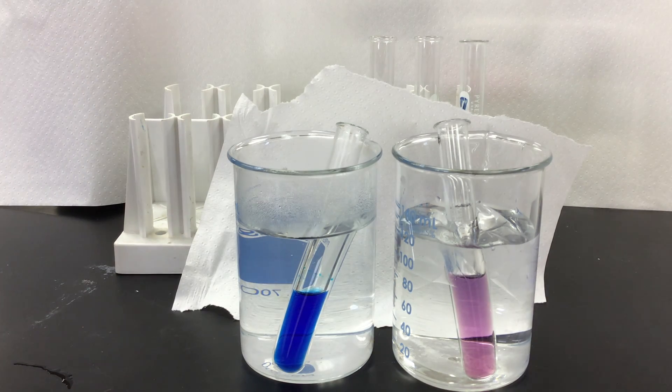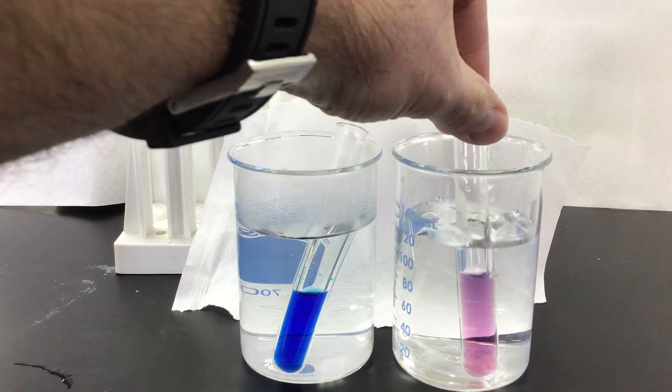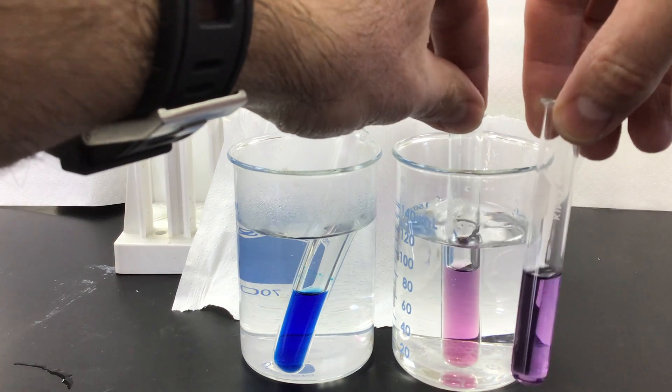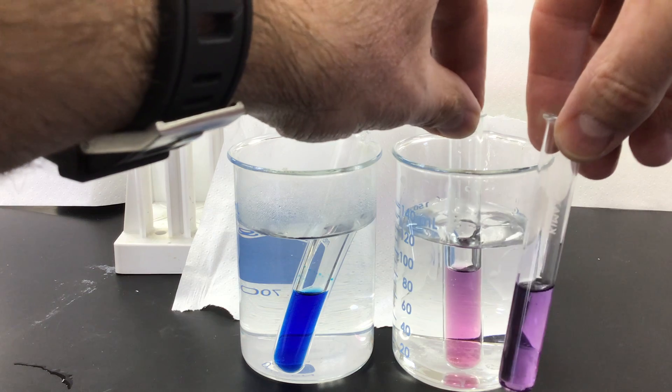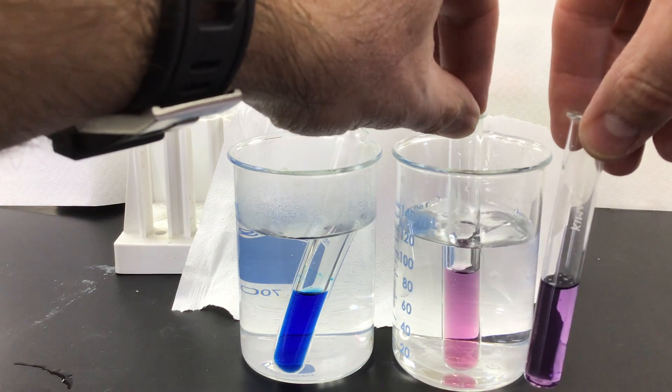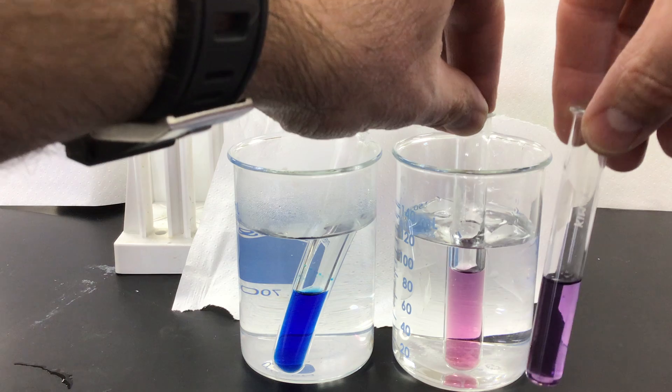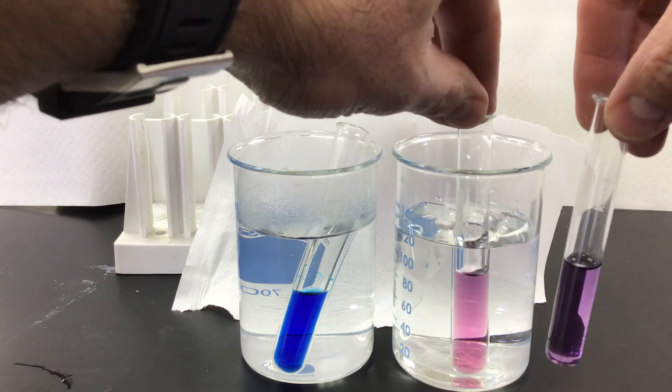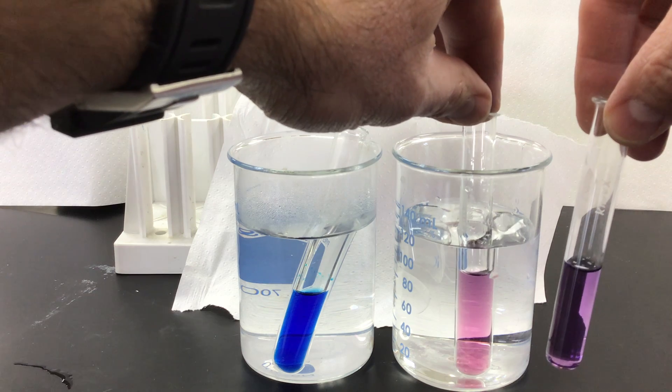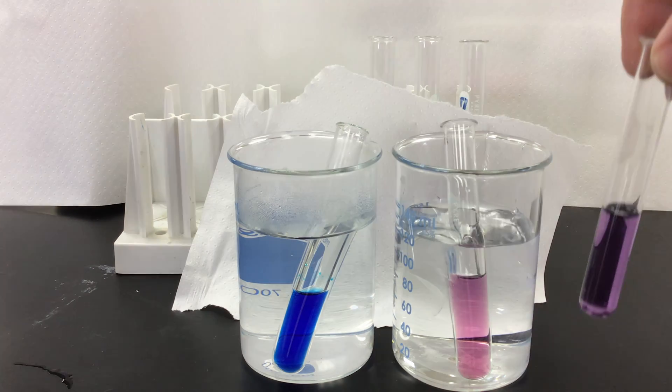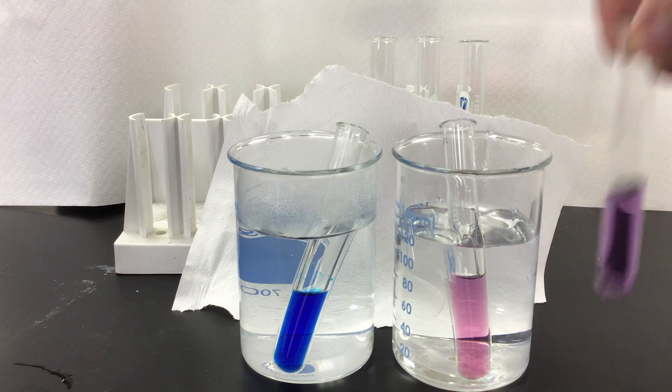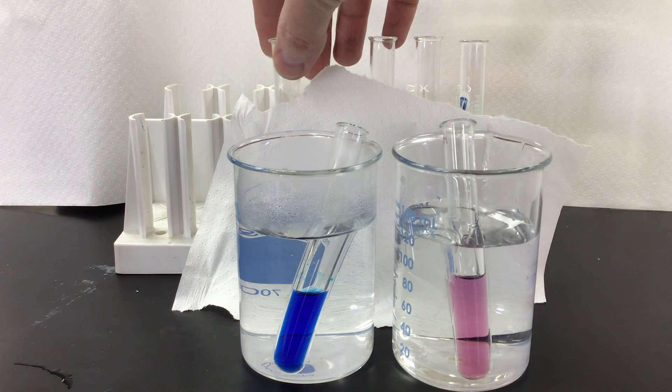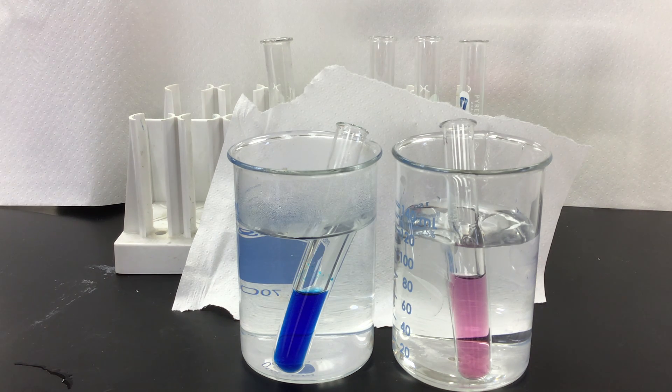Just as a good reference, if these are kind of next to each other, you can kind of see the color change. No longer purple, definitely more of a pink and the hot one is definitely blue and the one that is cold is turning pink. Definitely affected by changes in temperature, definitely shifting either to the products or reactants.